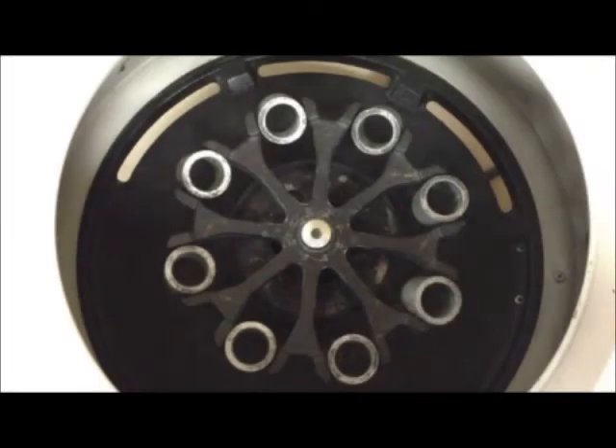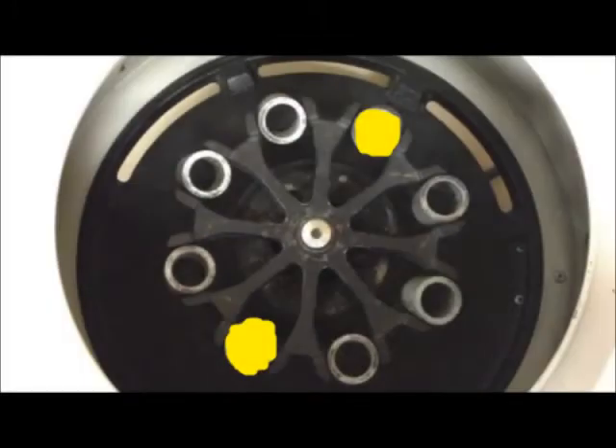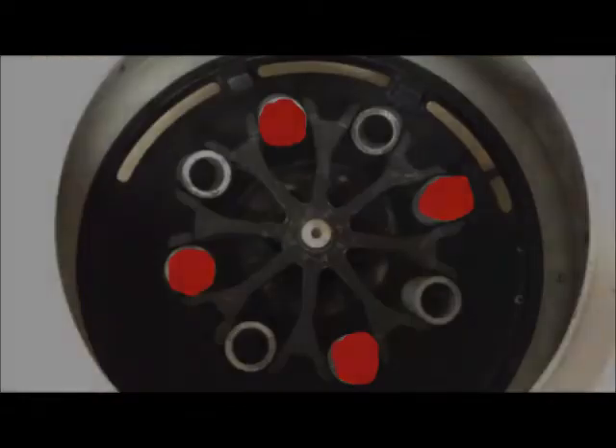As you can see, this rotor head contains 8 slots. For even spacing, this rotor head should hold an even number of specimens. For two specimens, they should be on opposite sides, and four specimens should be in every other slot.